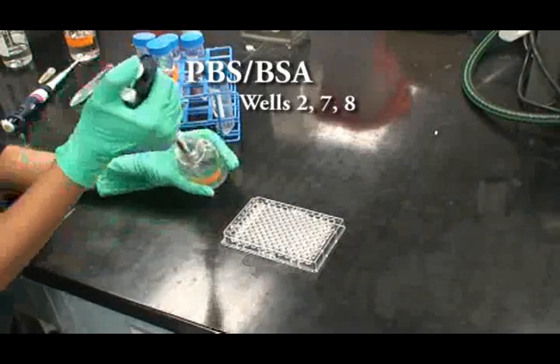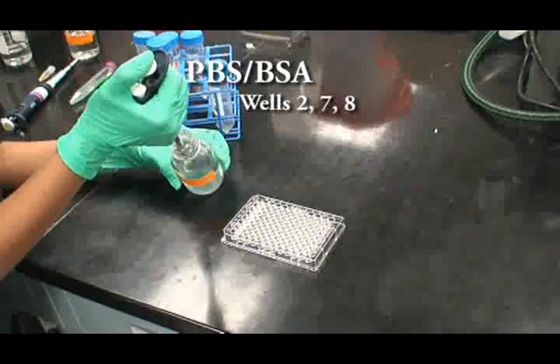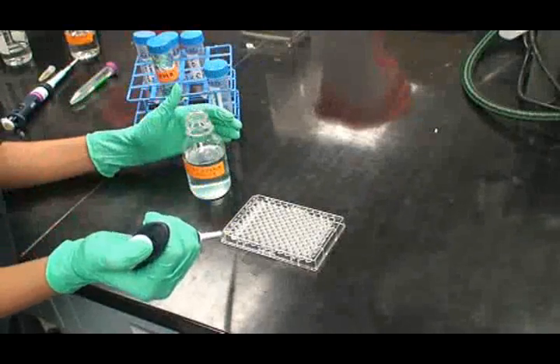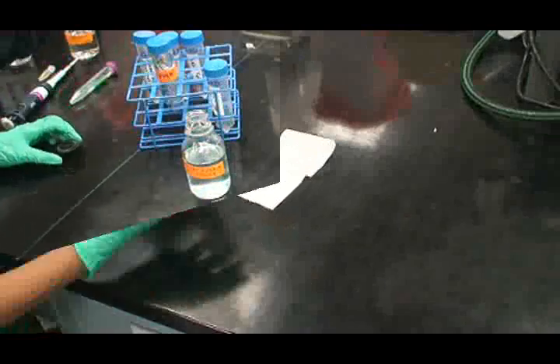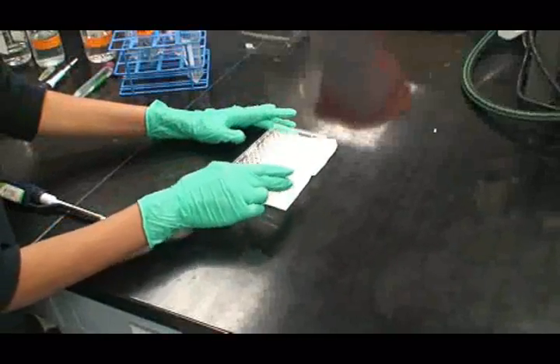Incubate at room temperature for 45 minutes. Empty and wash each well three times with 200 microliters of the PBS-Tween wash solution.